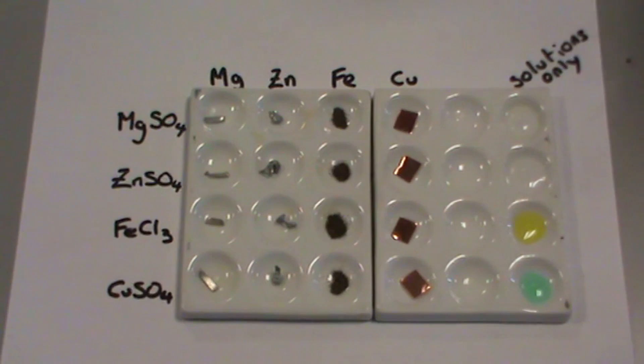Some of these reactions will be fast, some of them will be slow, and some of them will not react at all. When you have magnesium and magnesium sulfate, you would not expect any reaction to occur.